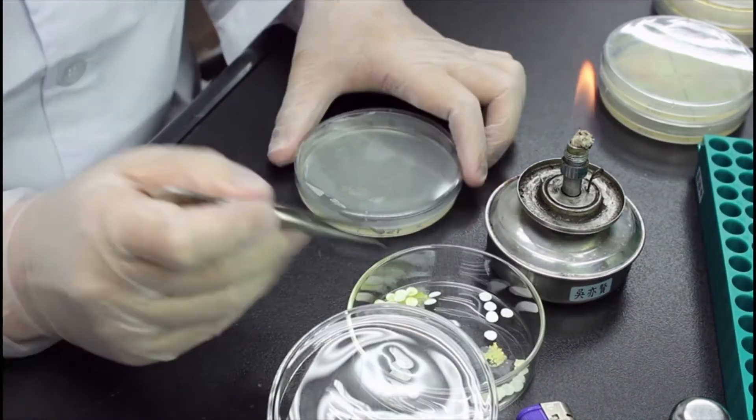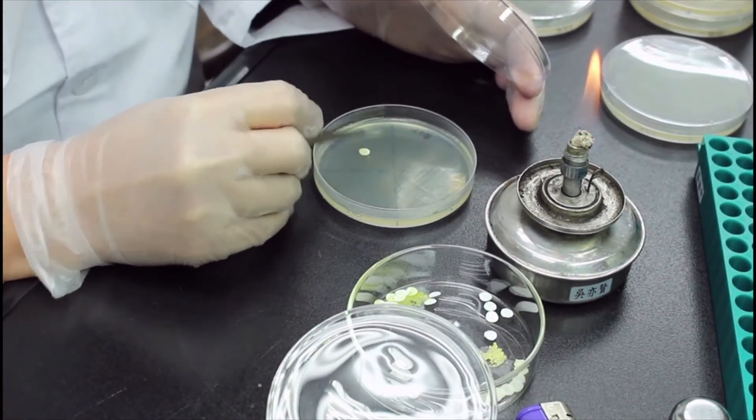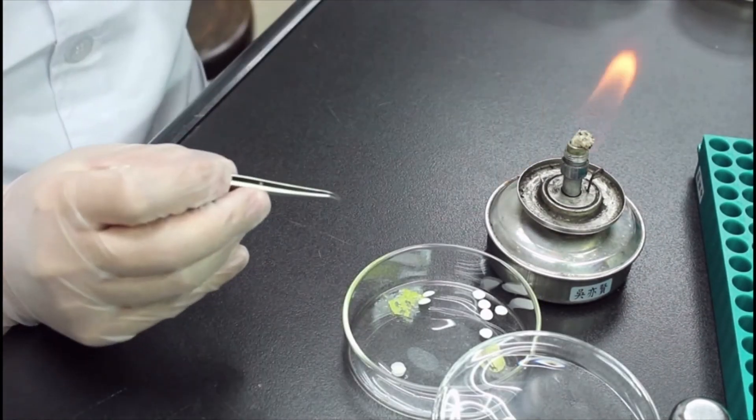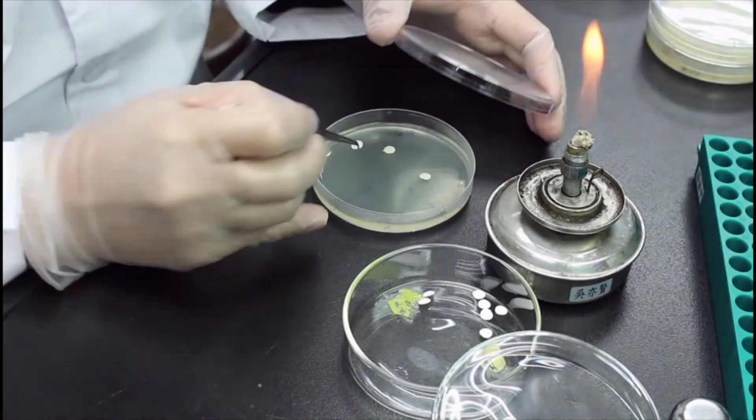Now all I have to do is to put the disk onto the right section of each plate and make sure they stay flat on the agar surface. Then I can take those plates and put them into the incubator.